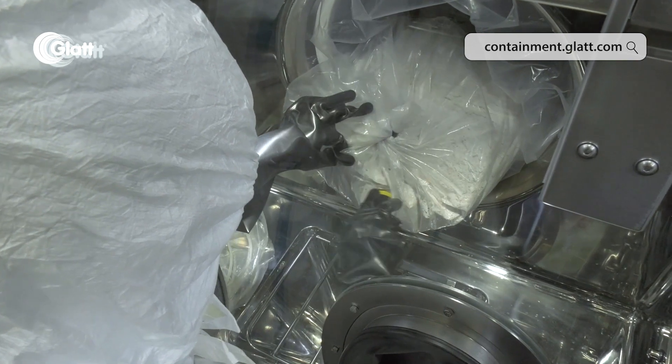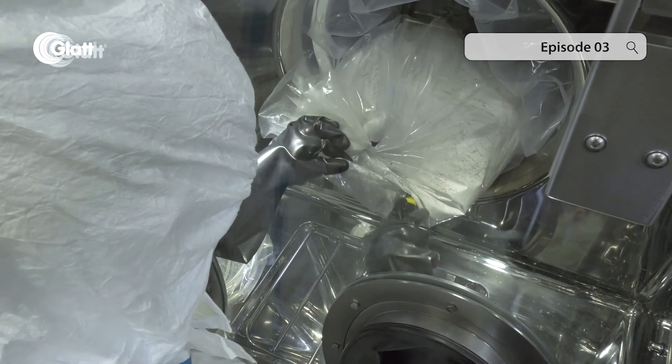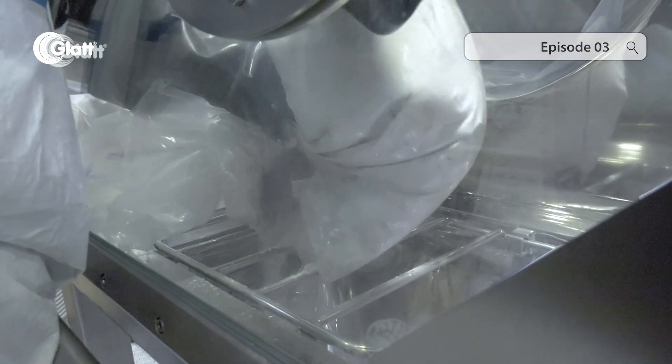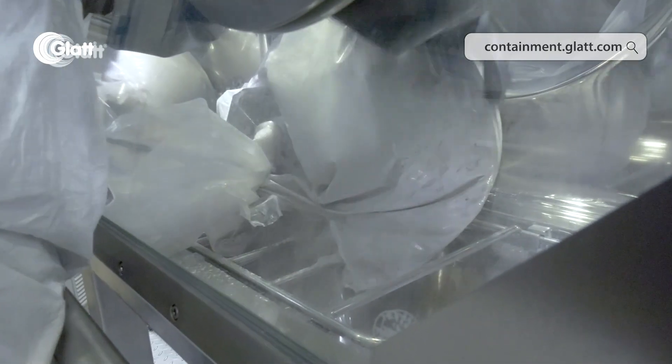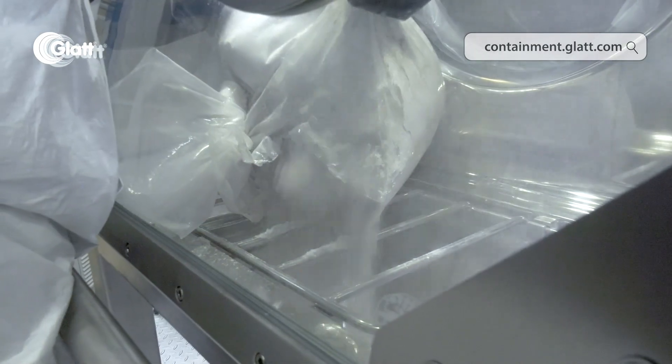The IBC is coupled to the isolator with a split butterfly valve. These butterfly systems can control dust emissions well below 100 nanograms per cubic meter. They are an industrial standard for dust-free filling of containers — we will talk about this in a future episode.